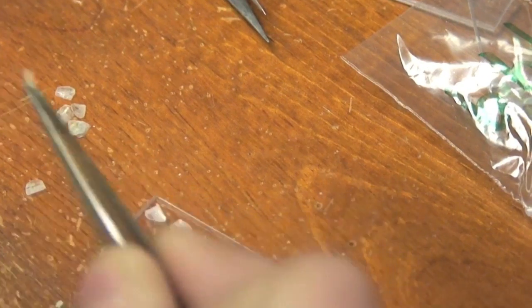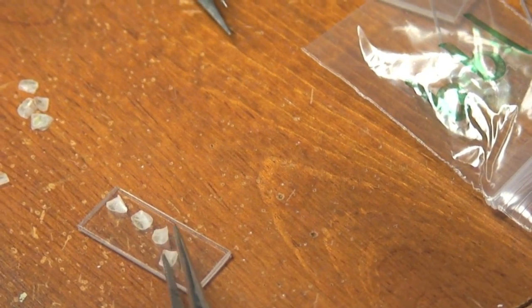To preserve the image of the scales, place them on a small piece of polycarbonate and run it through a press.